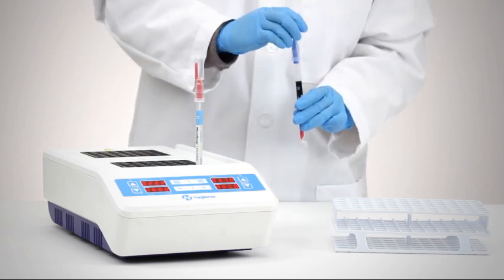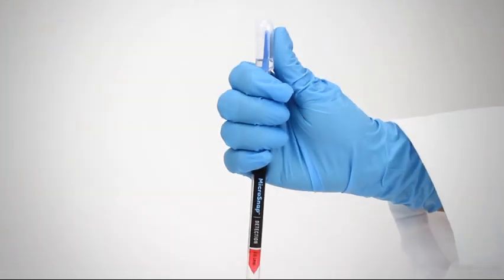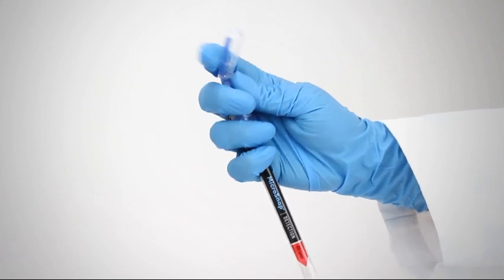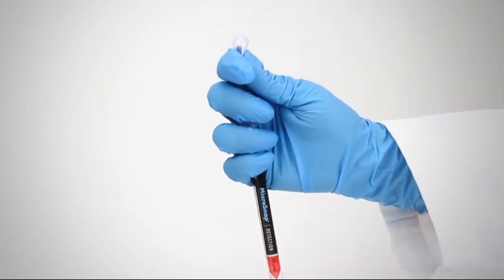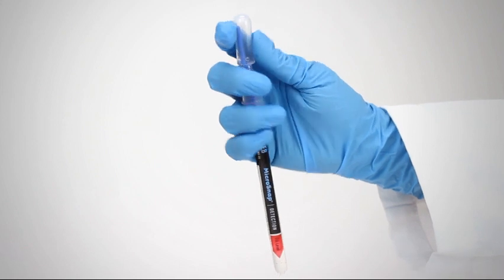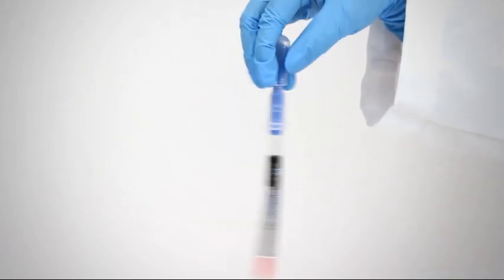Hold the device in your fist and use the thumb and forefinger to break the snap valve by bending the bulb forward and backward. Squeeze the bulb three times to expel all liquid into the tube and shake gently to mix.